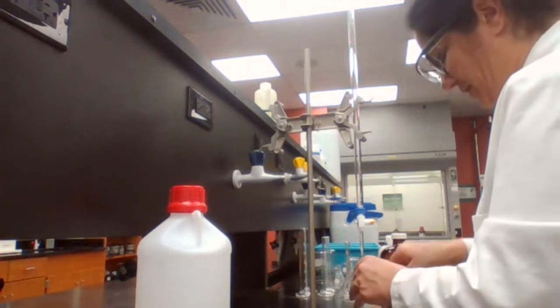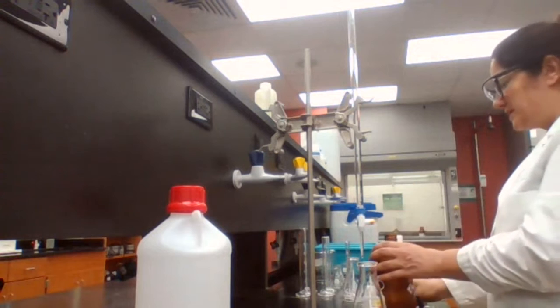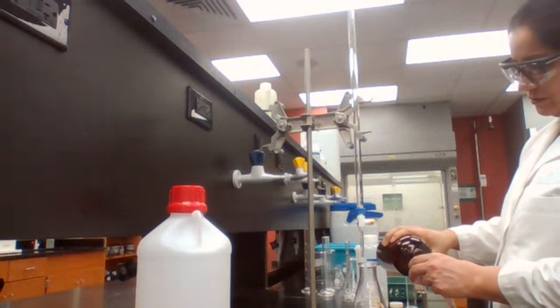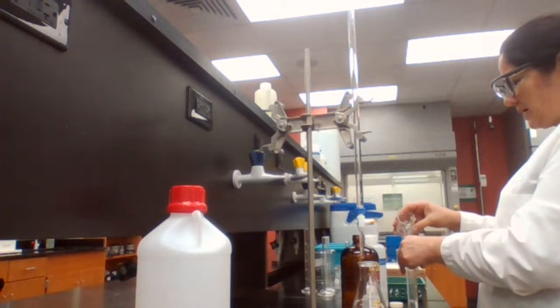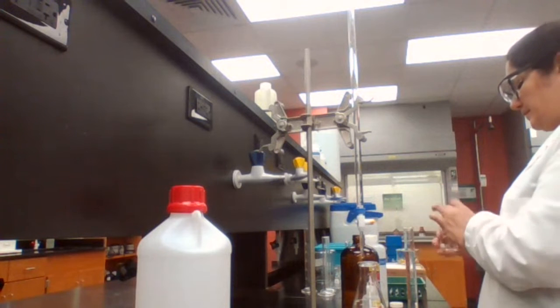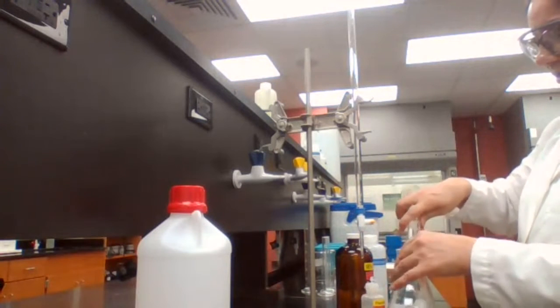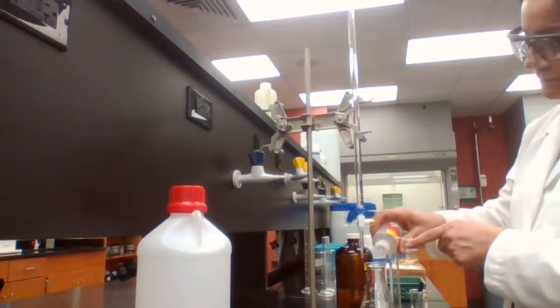The procedure is not the question today, it's what type of carboxylic acid you have that is the question, or what is the name of the carboxylic acid that you have. I'm going to follow the procedure just like the last experiment. The sodium hydroxide that I'm using is 0.1 molar. Those are the information you need. The mass of the acid that I used was 0.2 gram.